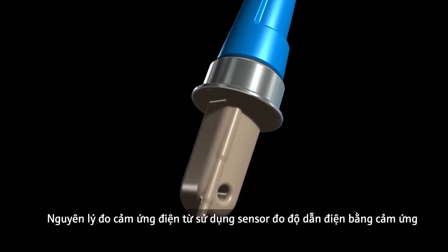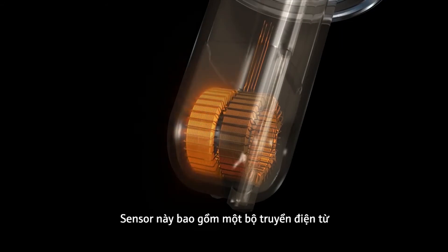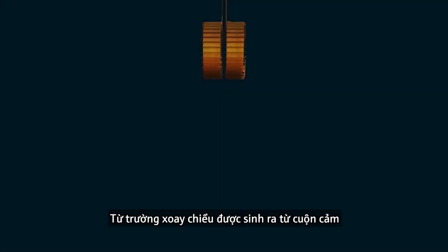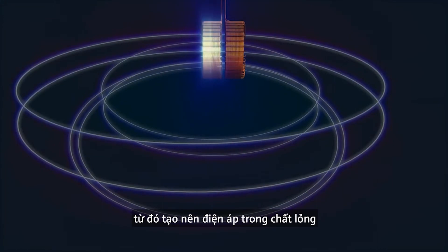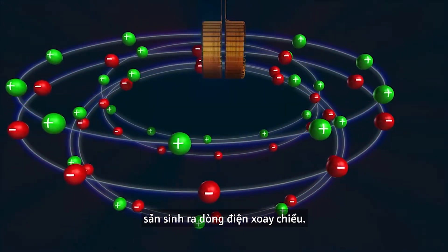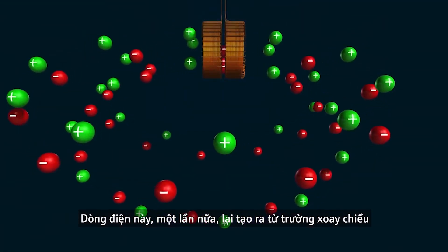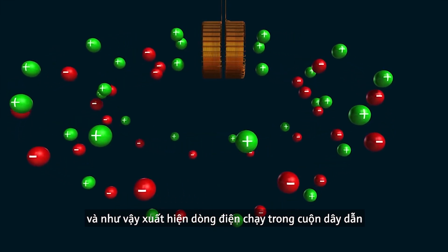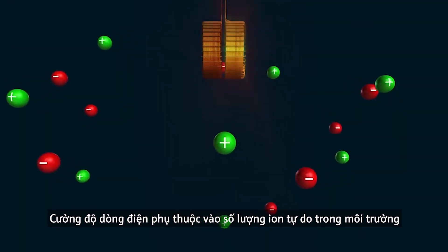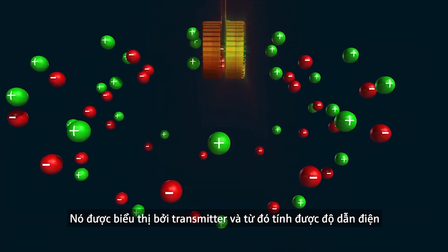The inductive measuring principle uses the inductive conductivity sensor. It contains an electromagnetic transmission and reception coil in a protective plastic coating. An alternating magnetic field is generated in the transmission coil, which induces an electric voltage in the liquid. This causes the positively and negatively charged ions of the liquid to move and generate an alternating current. This current again induces an alternating magnetic field, and thus a current to flow in the reception coil. The intensity of the current depends on the number of free ions in the medium, and the conductivity is calculated by the transmitter.